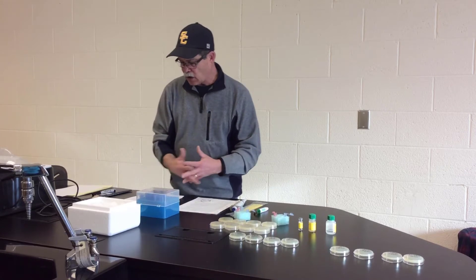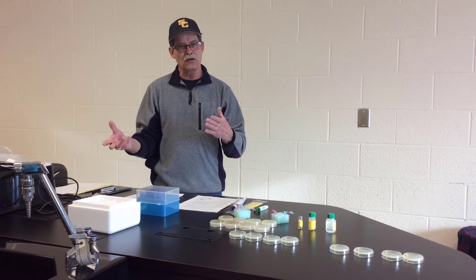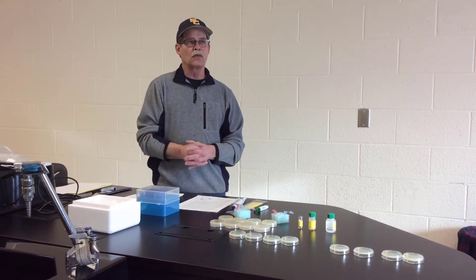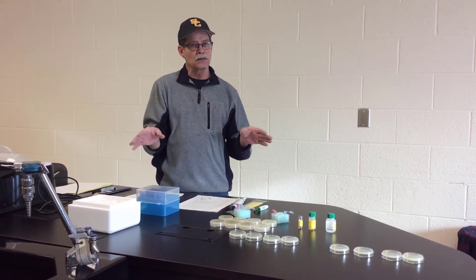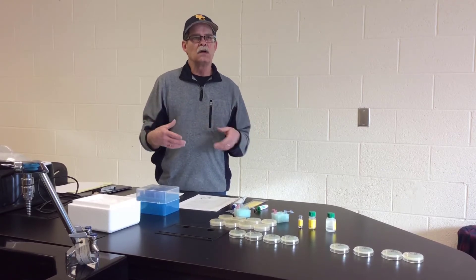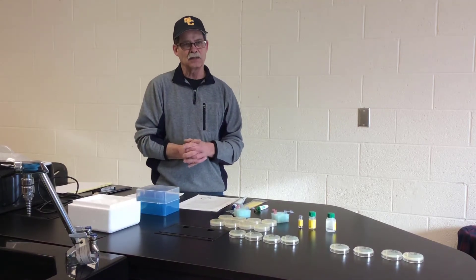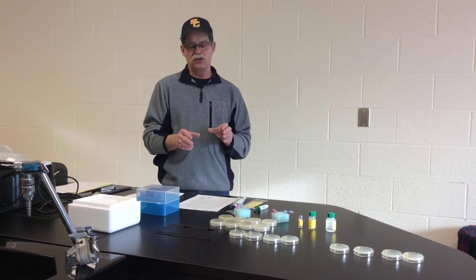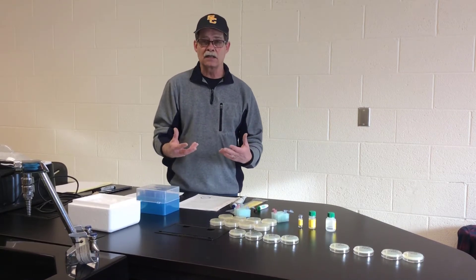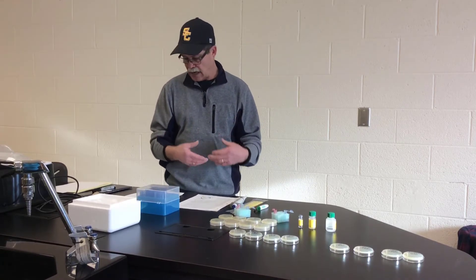Today we're going to learn about the process of moving genes from one organism to another using plasmids. You'll recall that bacteria have one large chromosome, but they also commonly have one or more small circular pieces of DNA called plasmids. These plasmids usually have genes for traits that are beneficial to bacteria, such as conferring resistance to antibiotics.